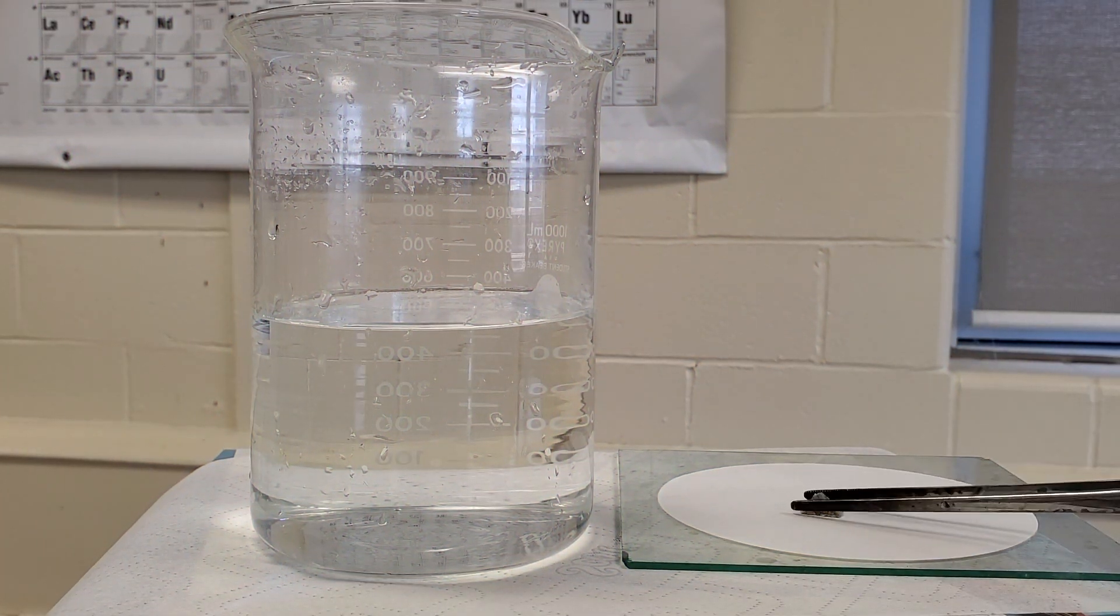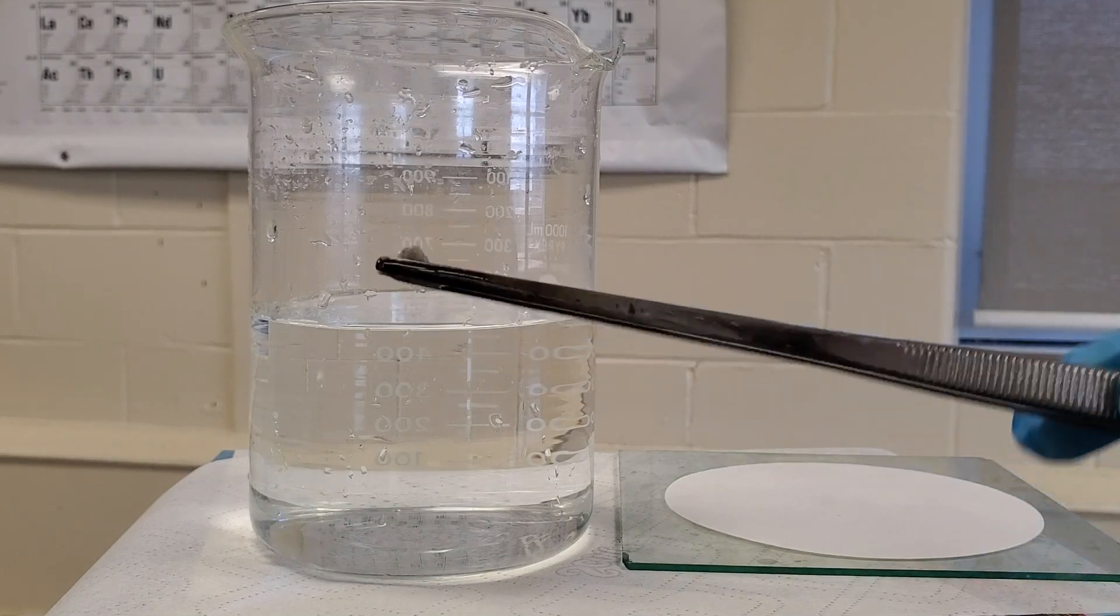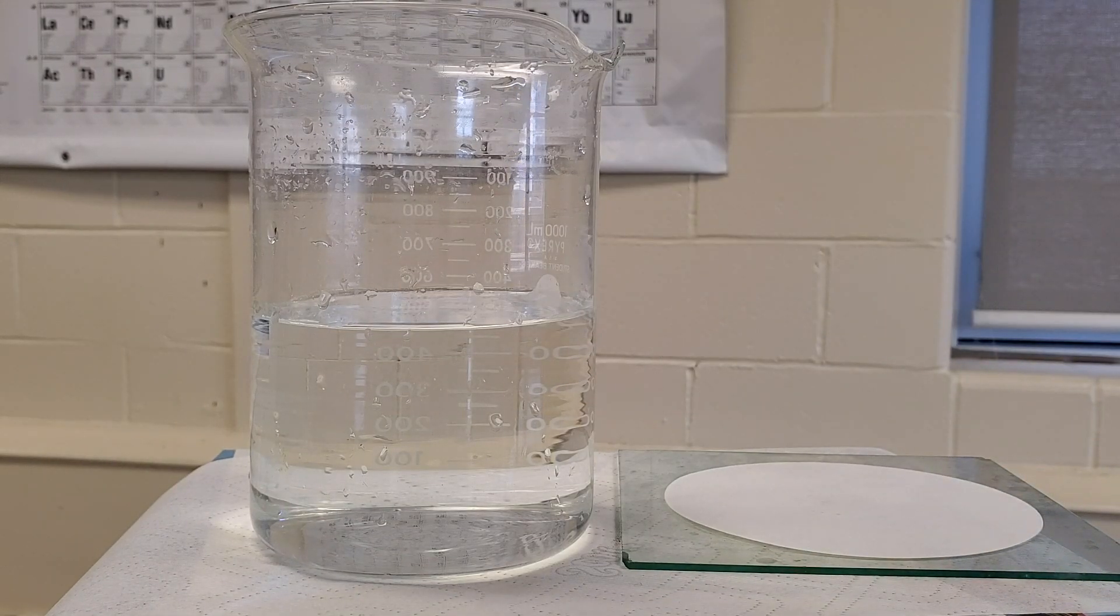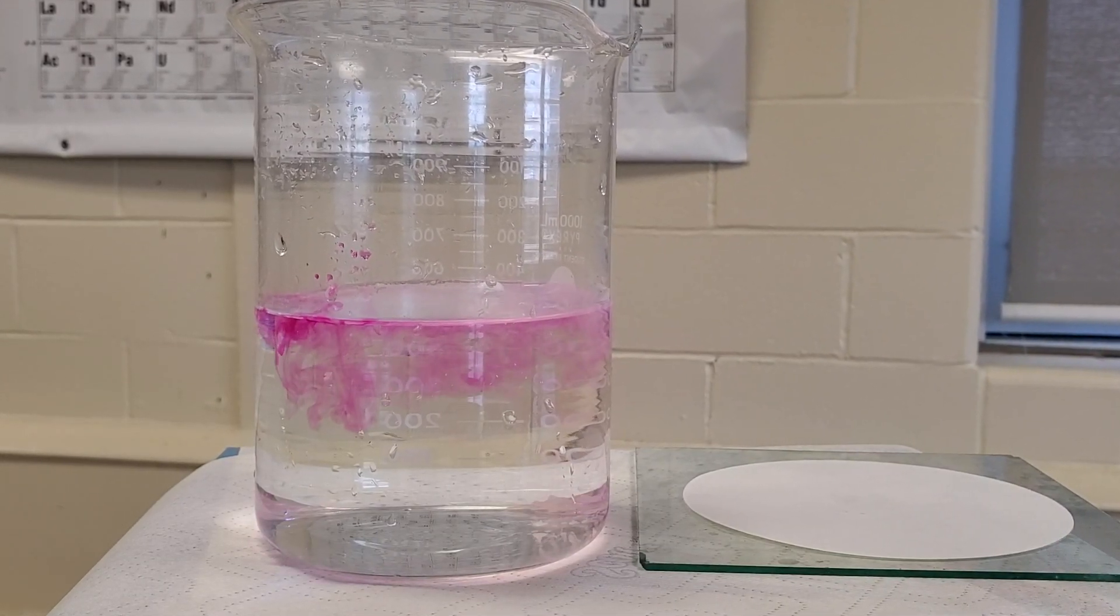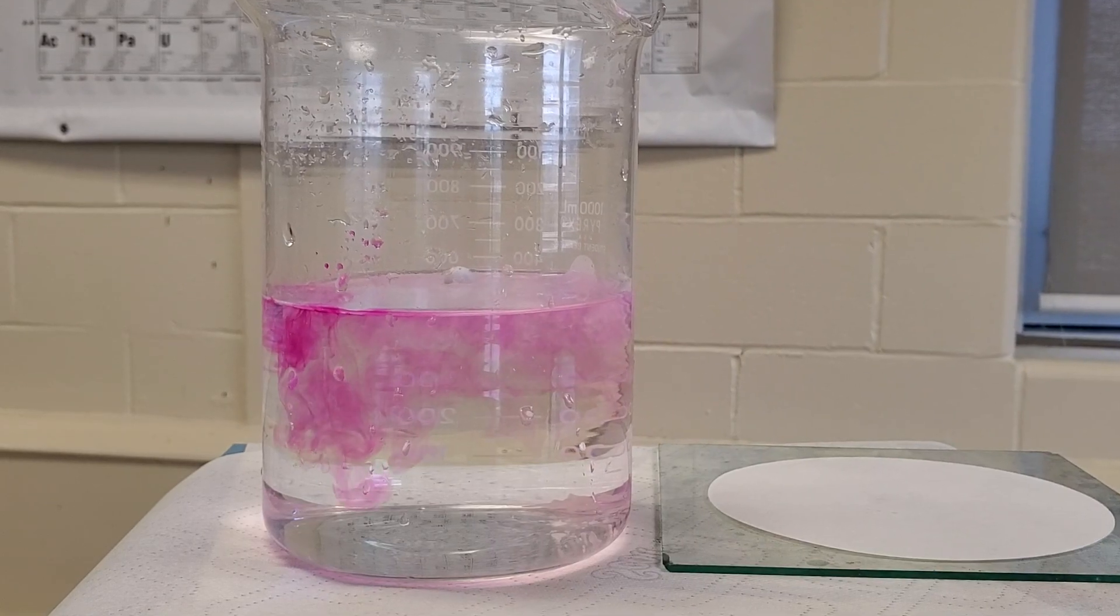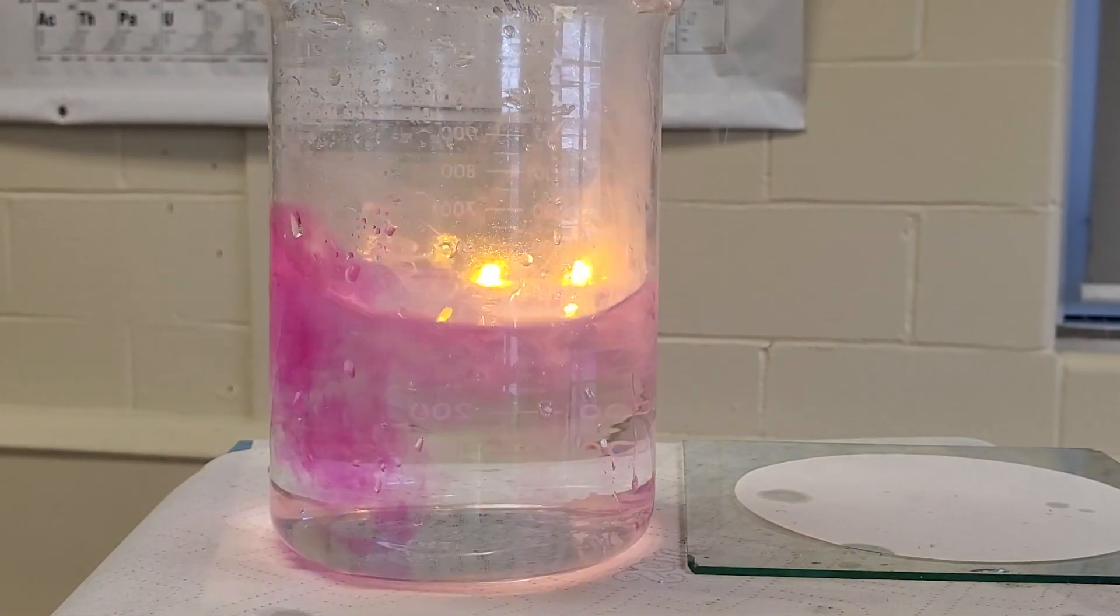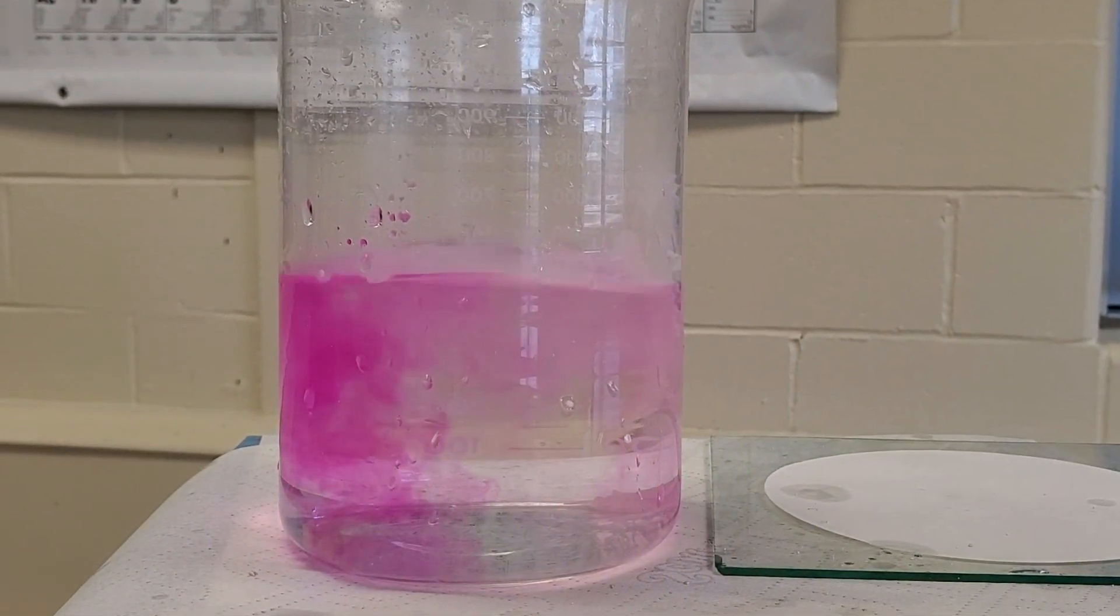Let's react sodium with water. I've already added some phenolphthalein to the beaker. As you can see, the sodium is more reactive than lithium. Unlike your typical metals, it reacts violently with water causing that little sample to explode.